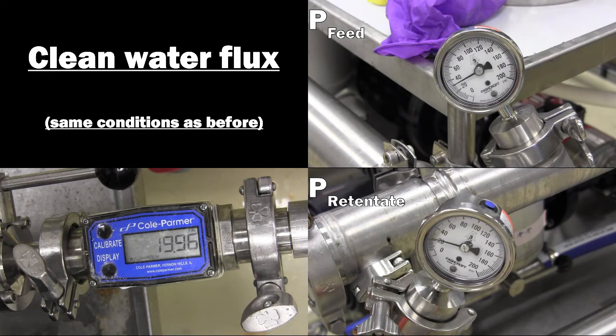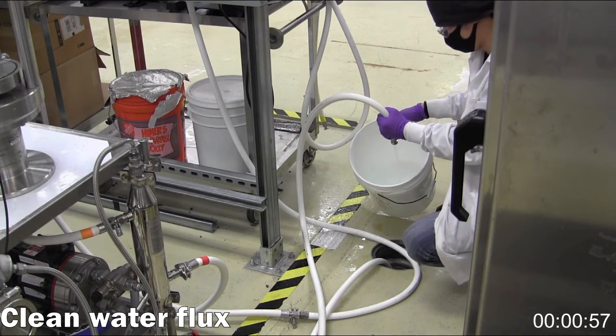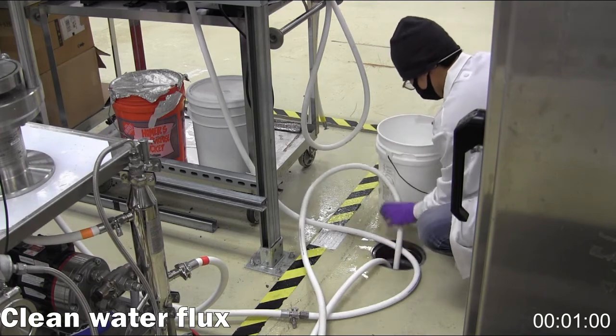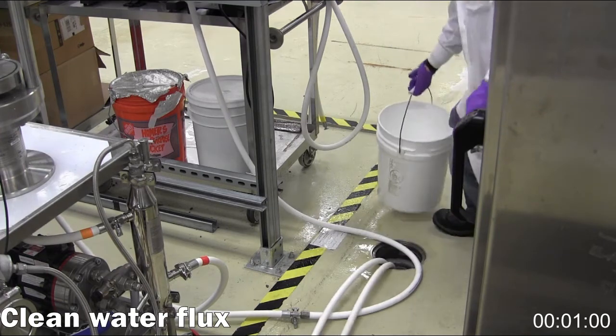Lastly, the clean water flux is measured in the same manner as before the processing. The end value should be similar to the original value, thereby validating that the membrane has been thoroughly cleaned and may be reused in future applications.